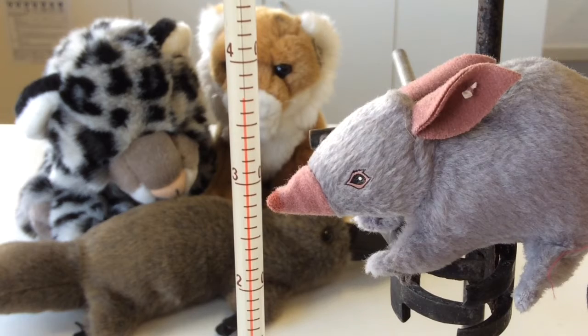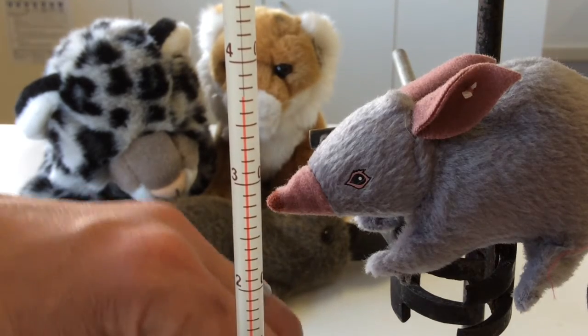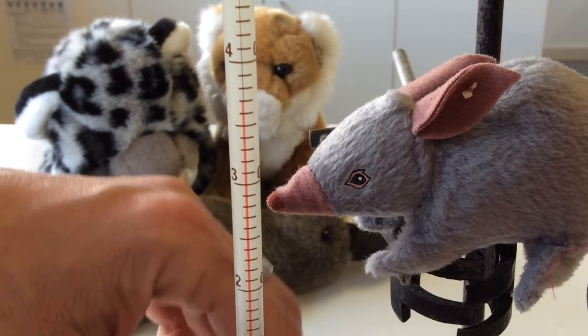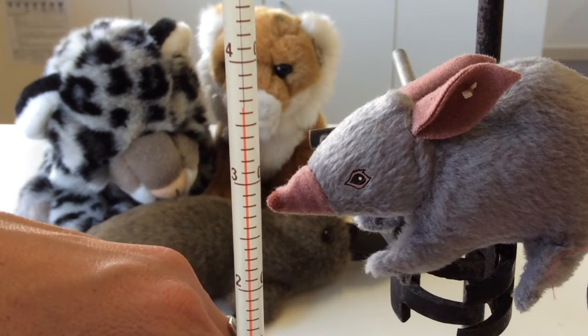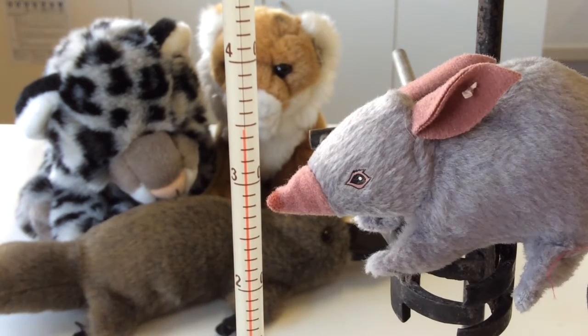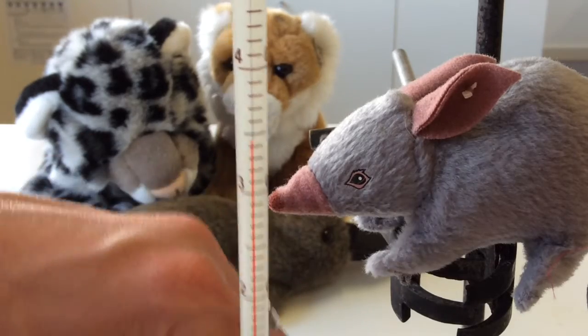Okay, it's starting to slow down, it's dropping now. So where was the highest? Oh no, interesting. I better keep stirring. I think that's because when I'm stirring, hang on, I haven't kept it uniform. Naughty me. So what was the highest temperature that we got to for that reaction? That was the hydrochloric acid and the magnesium. It'll start going back up now because I've stopped stirring it. But as soon as I start, record that top one that you got.